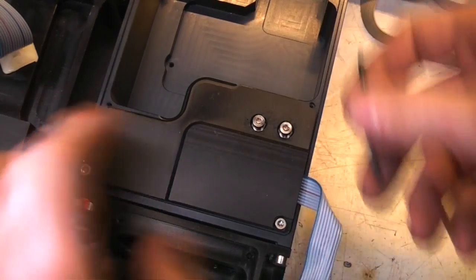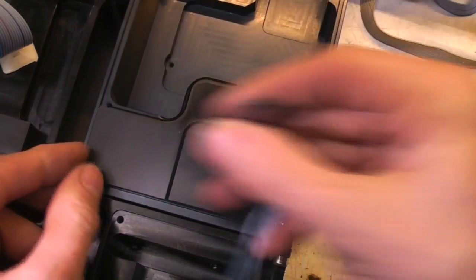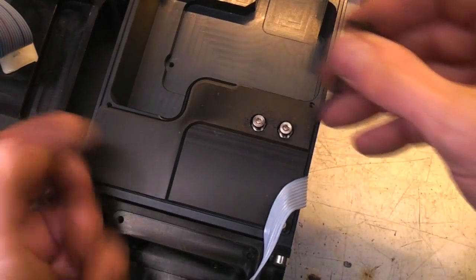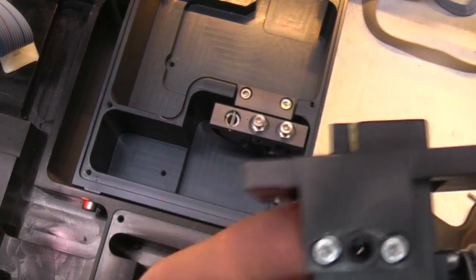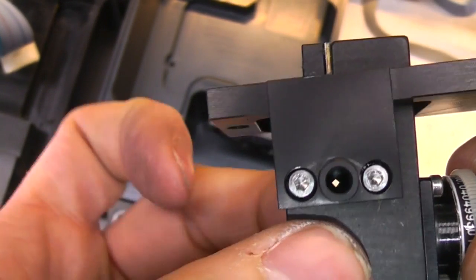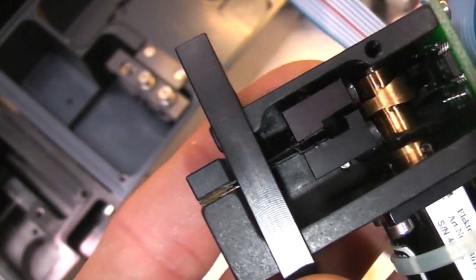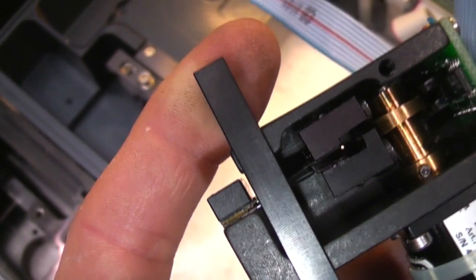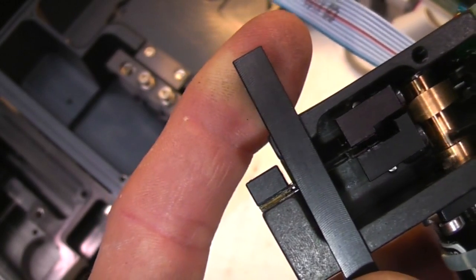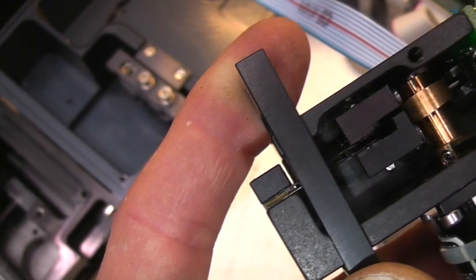Right, there's something behind this panel here. Instead, I've taken out the Acousto-optical beam splitter module. I'll take a look at that later. And this appears to be a little motorized iris. As I turn that motor, you can see there's these 2 blocks there and a sort of cam that operates them. So as you can see, as that rotates, that central hole gets larger or smaller, so that's probably just a sort of beam attenuator or something.